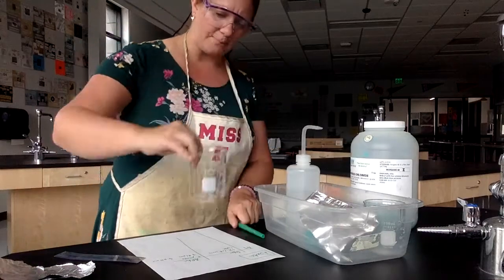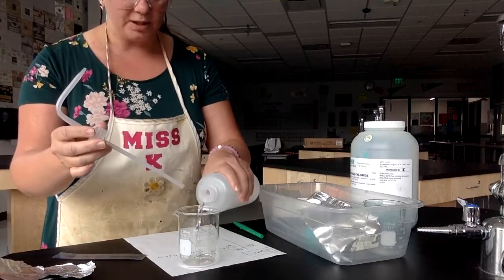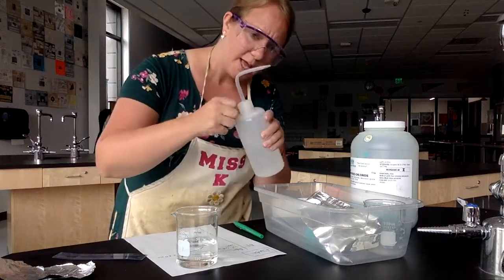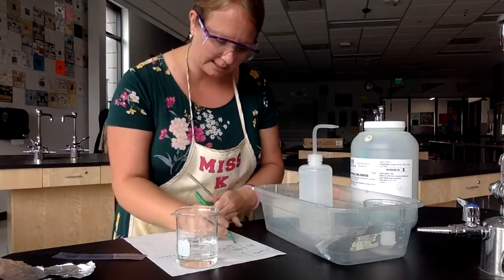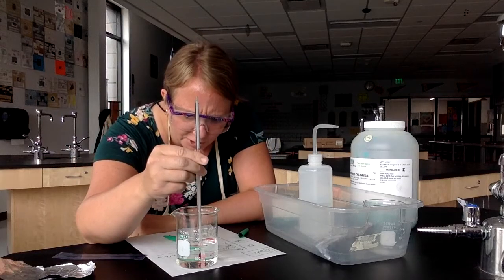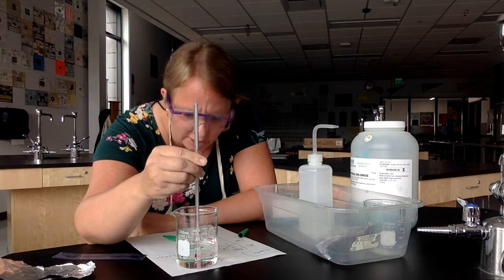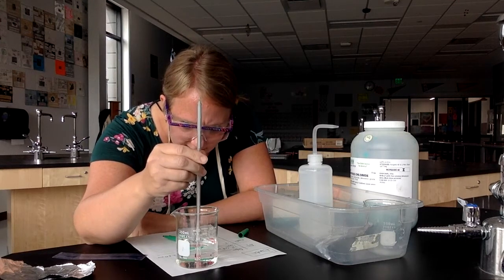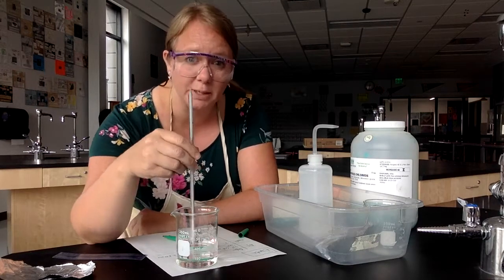Let's do our second one. I've got a 250 milliliter beaker here and I'm going to pour some water in it. The lab didn't say how much to add, so I'll add about this much. It said to record the temperature, so that's my next thing. I'll get the temperature — it's about room temperature, but let's see what it is right now. We record the temperature until it stops changing, and it looks like it's going to stop right on 25.0 degrees.